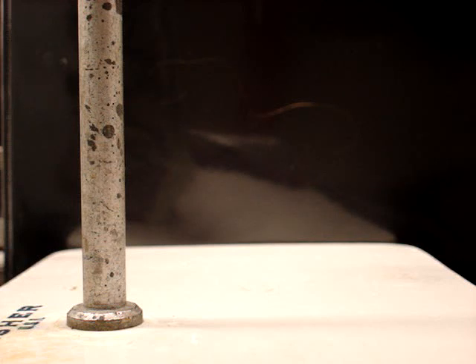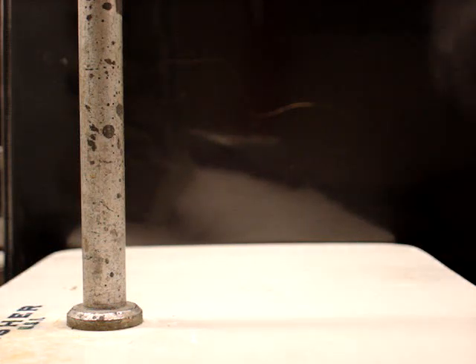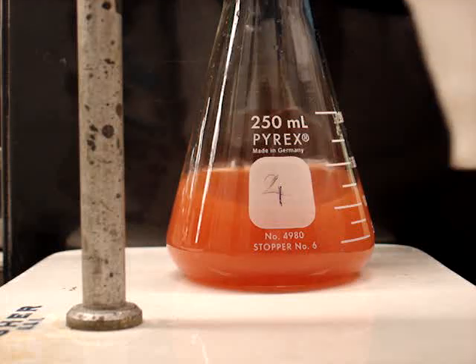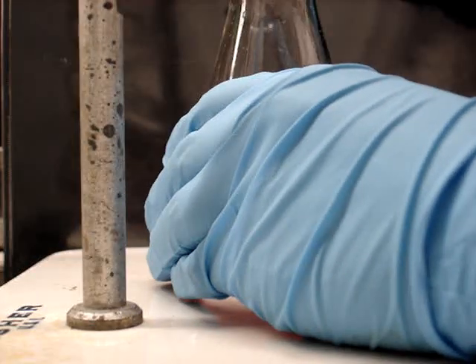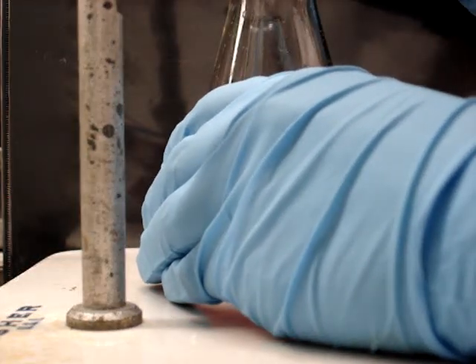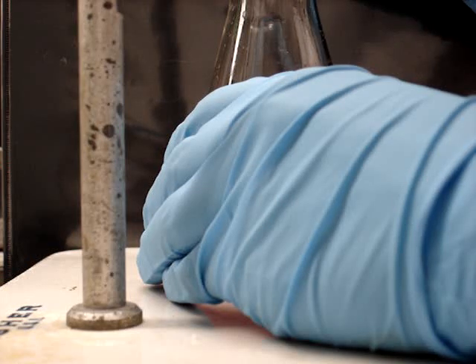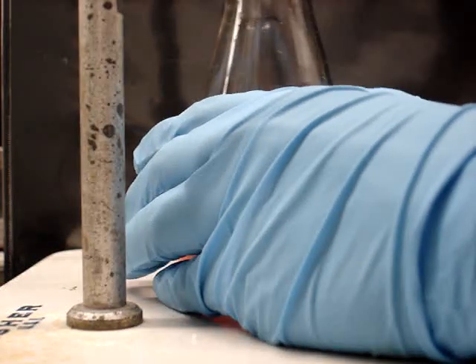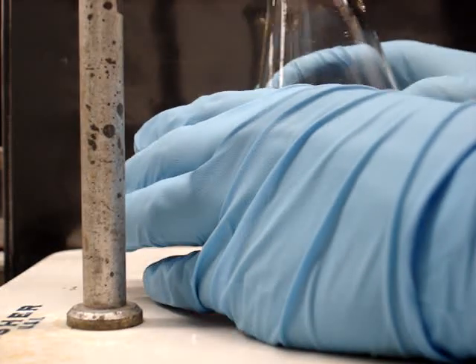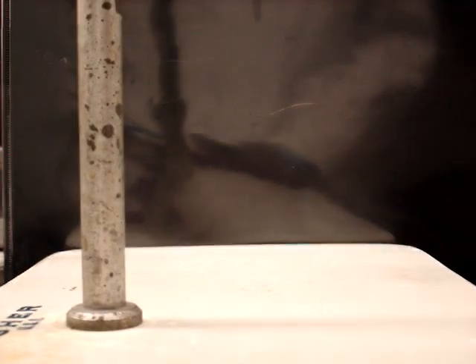You can see it. Oh yeah, that's it right there. Okay.